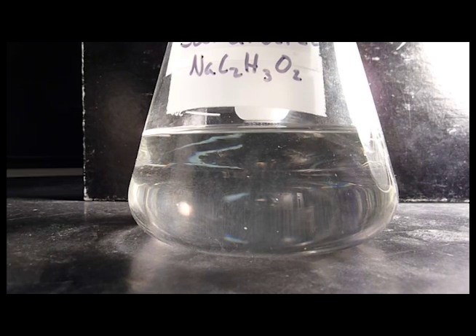What we have right here is an Erlenmeyer flask with a little bit of a supersaturated solution of sodium acetate.